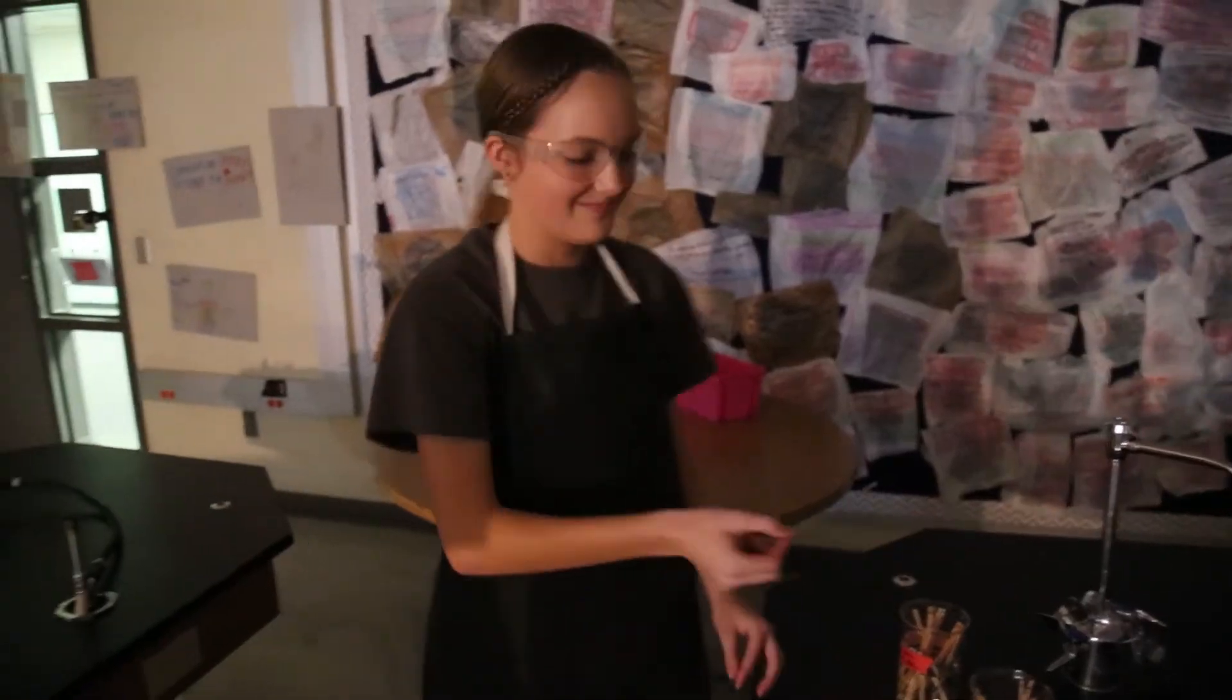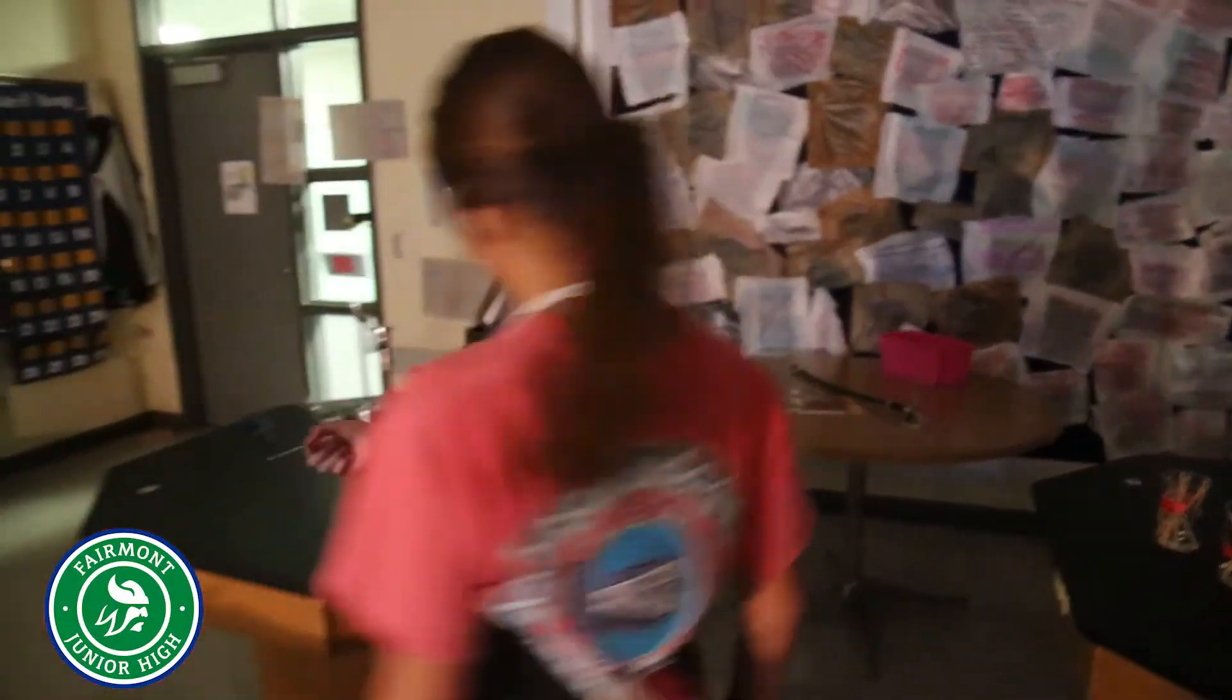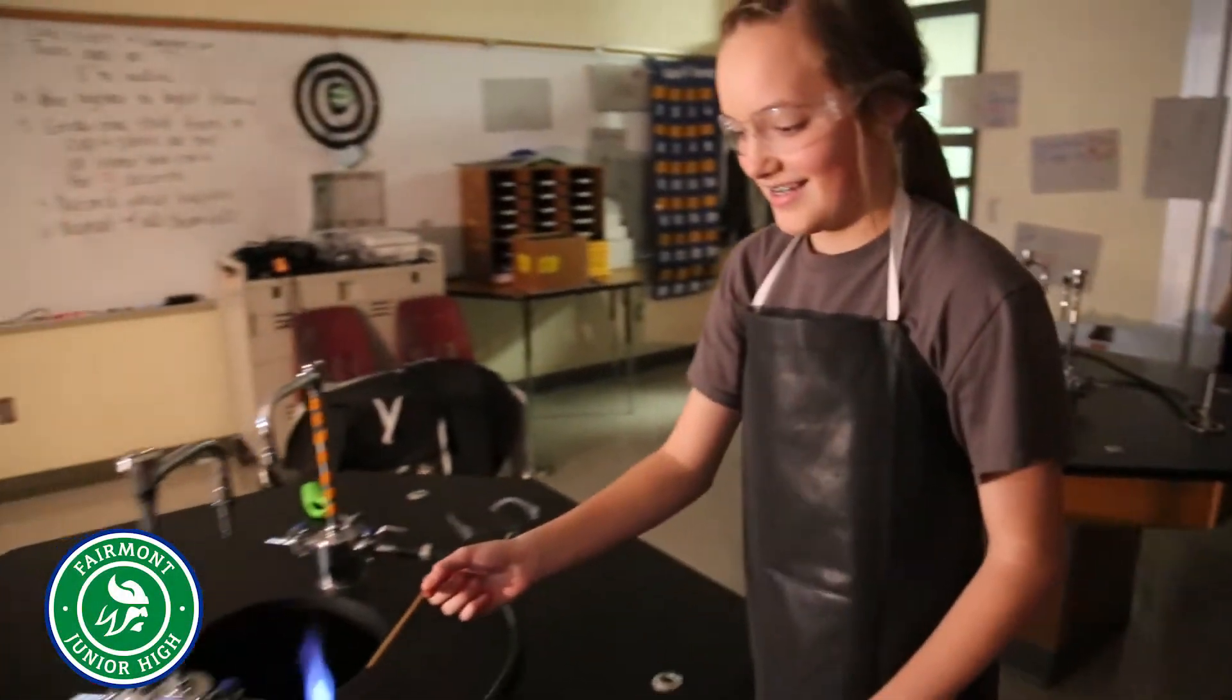Today we're doing a flame test, putting different salts over an open flame and seeing their reactions. We're seeing if they change different colors or if they split the flame in different ways.